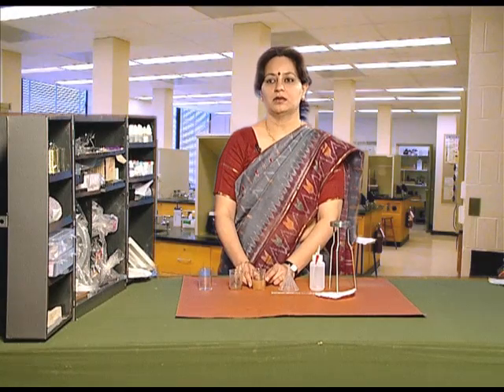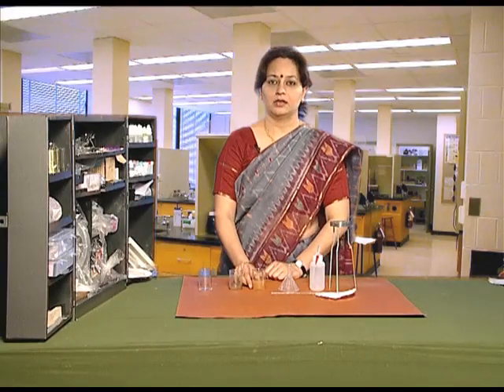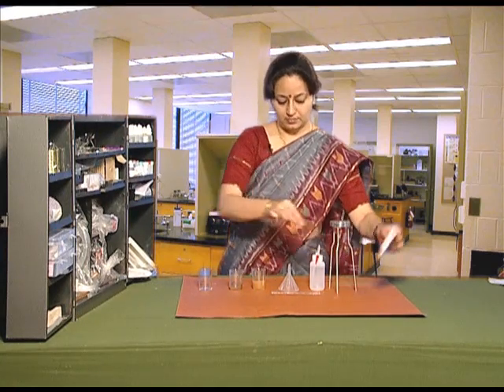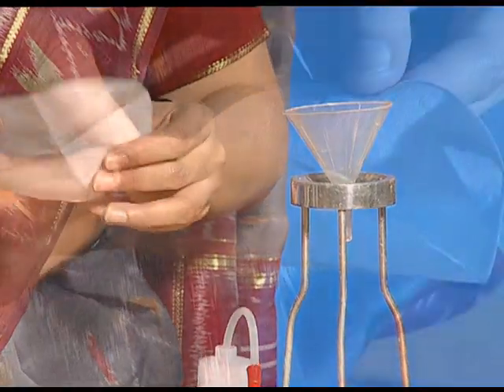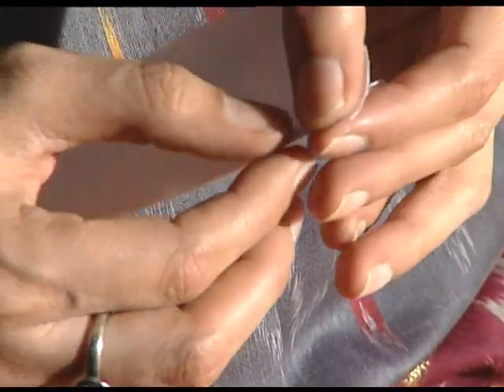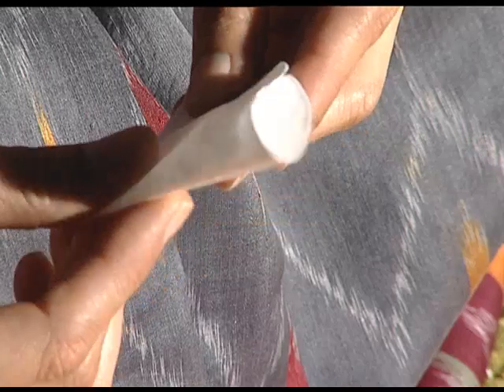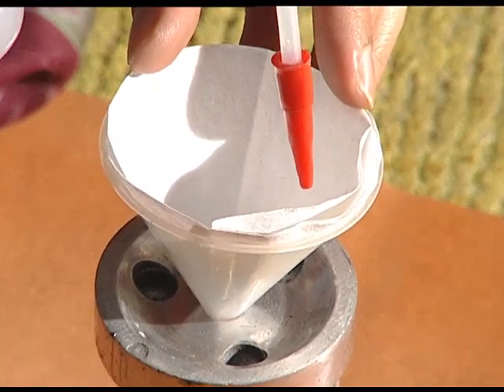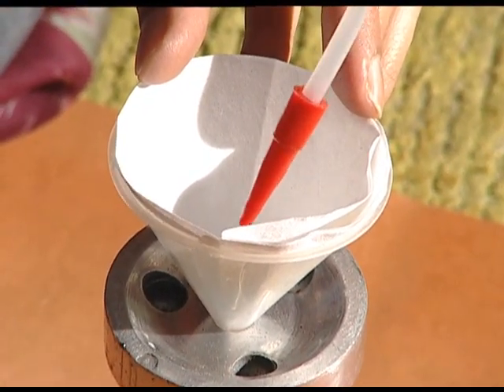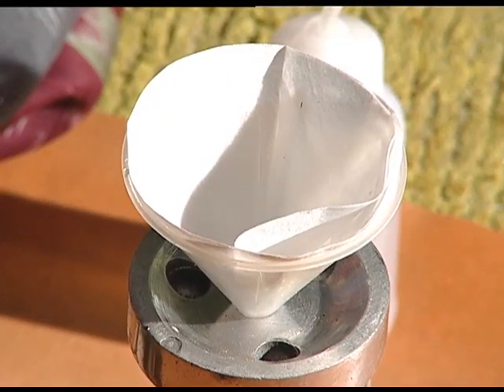The water in the first beaker is not clear. To further clear it, we will use a filter paper. Take a funnel and place it on the tripod stand. We will fold the filter paper in the form of a semi-circle, then fold it again in the shape of a cone, and place it on the funnel. With the help of the wash bottle, we wet the filter paper so that it sticks on the funnel.